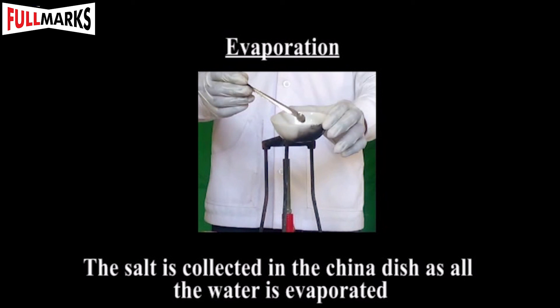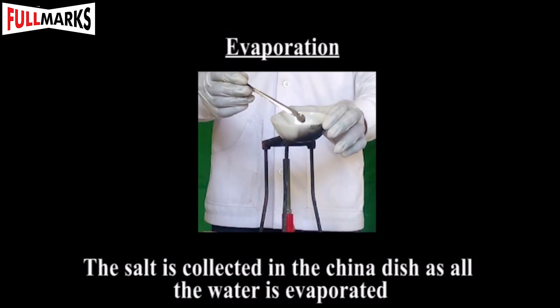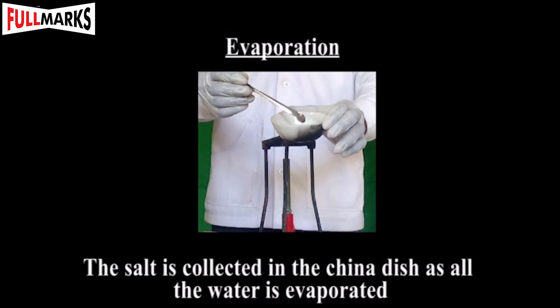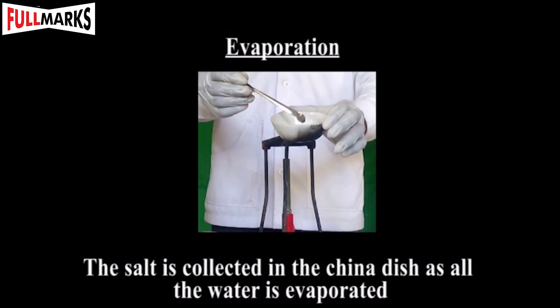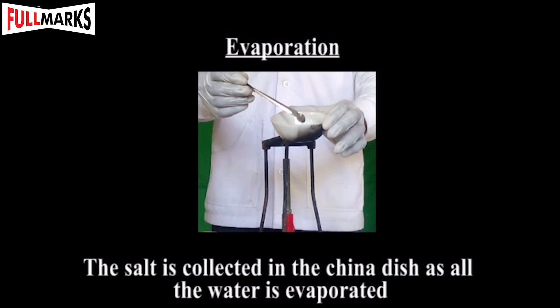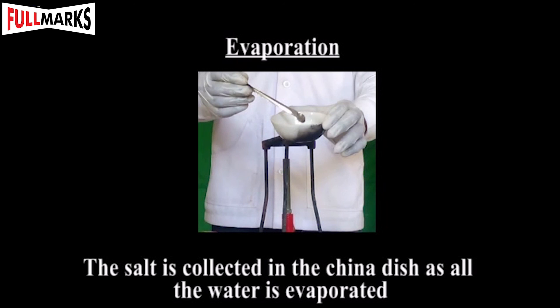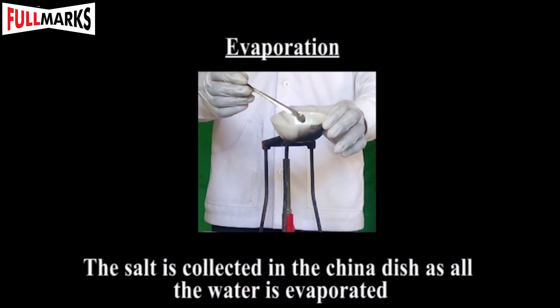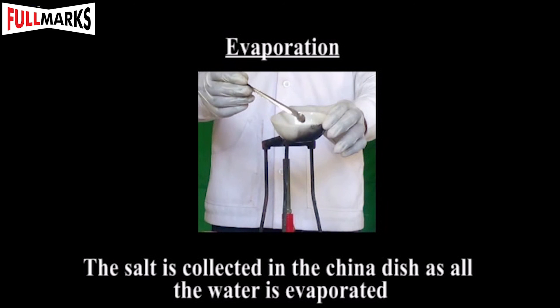Evaporation — Separation of common salt: The filtrate obtained in the beaker in the previous step consists of common salt solution. Transfer it to the china dish. Place the china dish on the tripod stand with the Bunsen burner and heat it with a small flame until all the water is evaporated. The salt is collected in the china dish once all the water has evaporated.